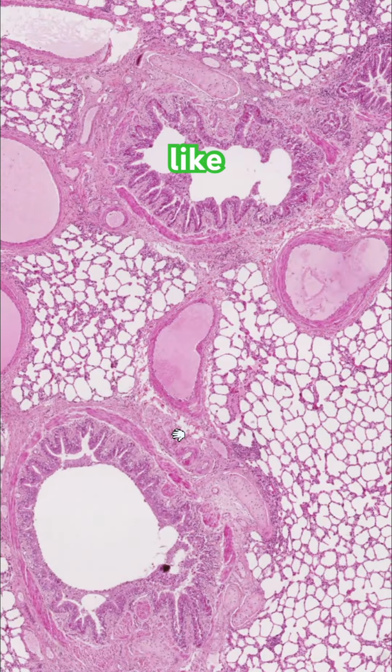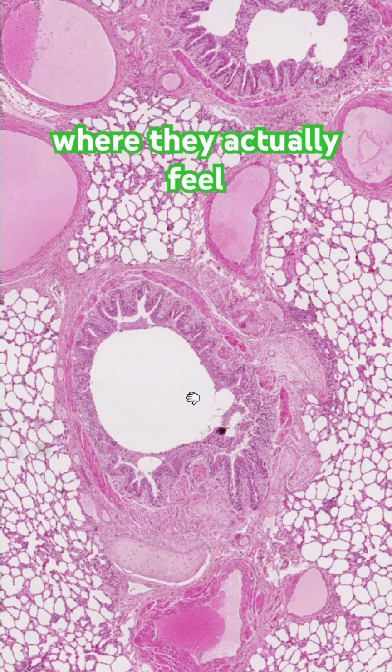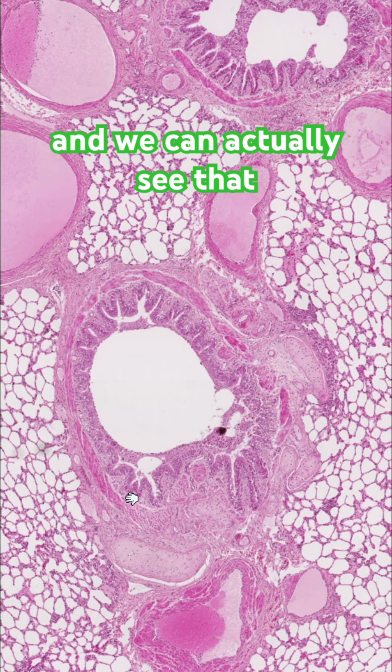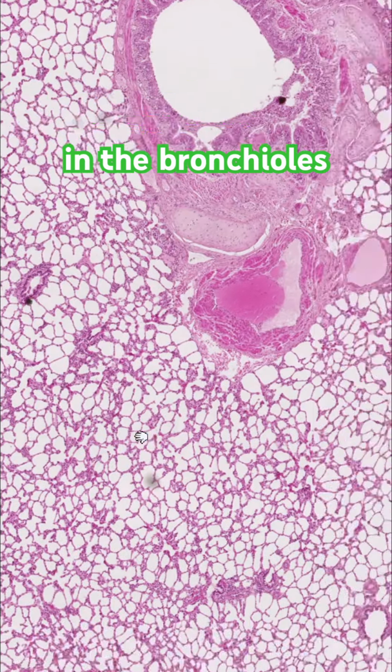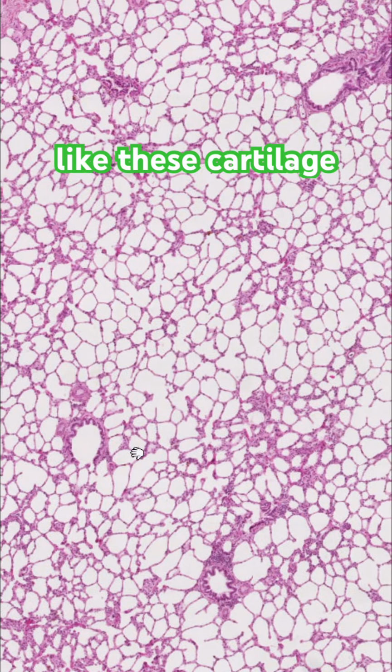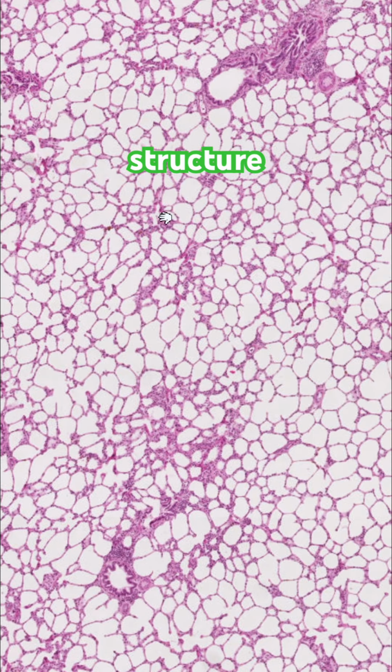So I really like showing this with lung dissection, where they actually feel the different textures of tissues in the lung tissue and the trachea. And we can actually see that difference of texture in the bronchioles and the lung tissue itself. So here we can see some light, fine lung tissue in comparison to something like these cartilage rings that are much darker and denser, and that relates to structure and function.